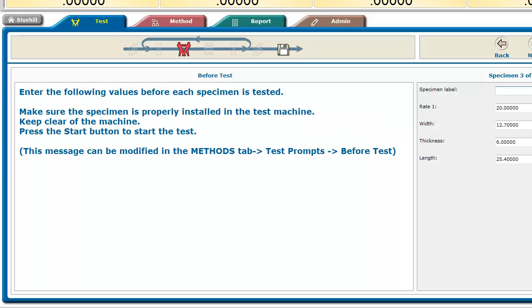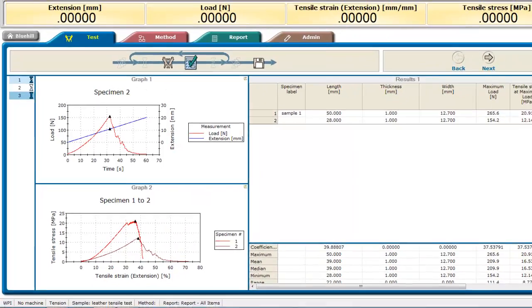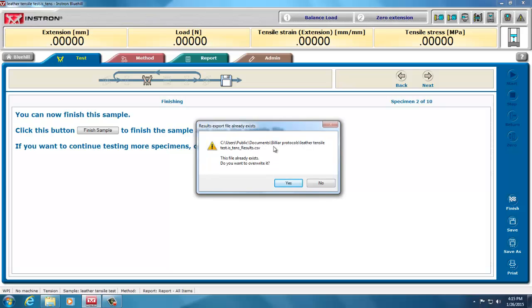So going back, continuing the sample that I did, when I hit Save As, it showed me where it might be. Another way of doing that is I can go back and look at my data of the tests that I've run, and then when I hit finish to save the sample data and finish sample, it tells me the export file already exists, but it also tells me where it was saving it. It was saving it under Billiar protocols, not under users public, and not under the place I thought it was.